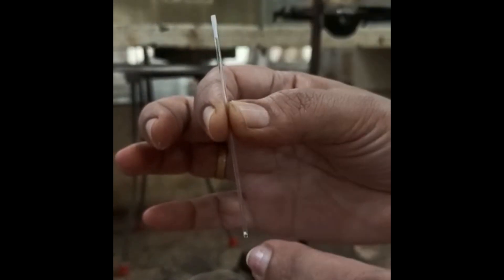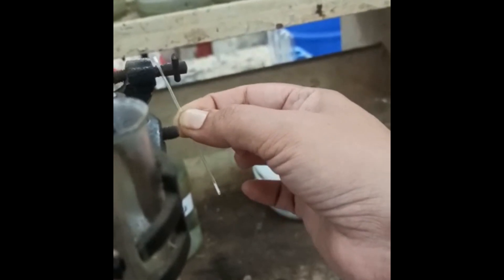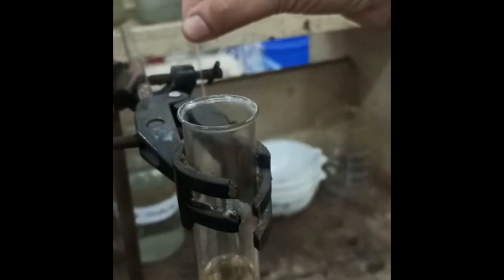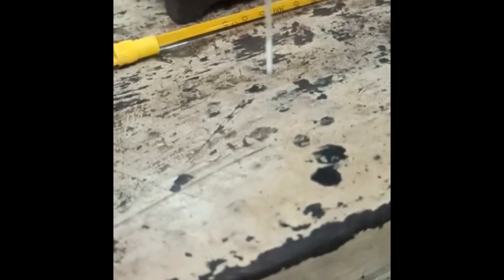Now our aim is to transfer this substance from the upper end to the lower end. You can do this by rubbing the capillary over a rough surface. You can see visually that the substance is moving down. You can tap the substance downward over a tabletop and attach this capillary to the thermometer, where the mercury and your substance will be at the same level to show the melting point of the substance as exactly the temperature of the mercury.